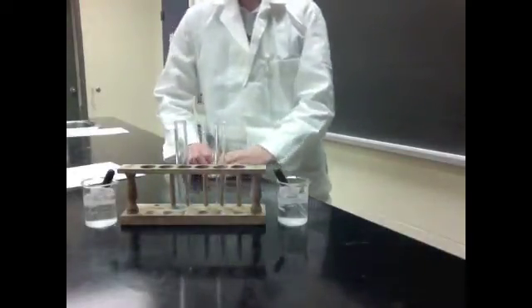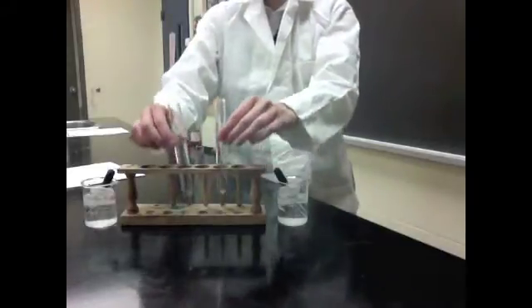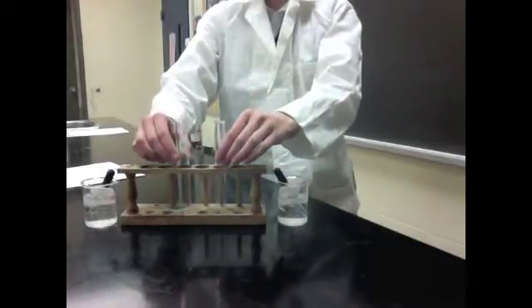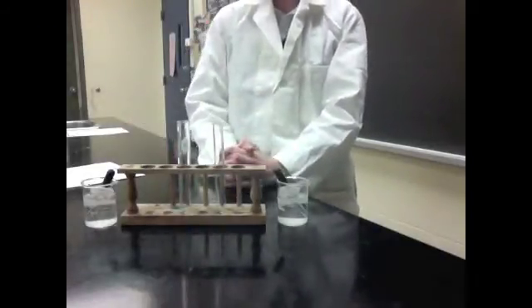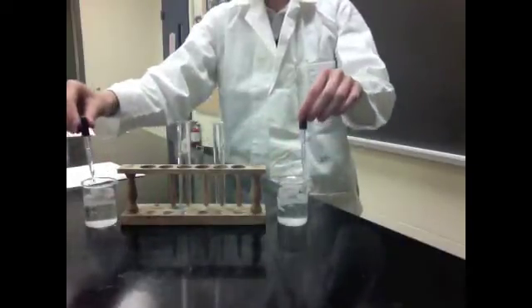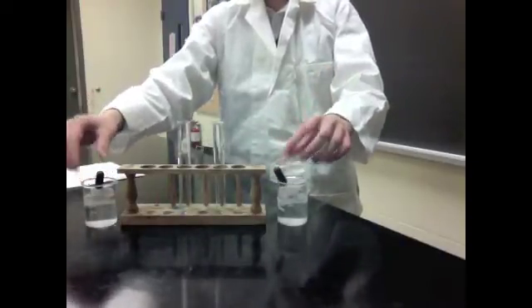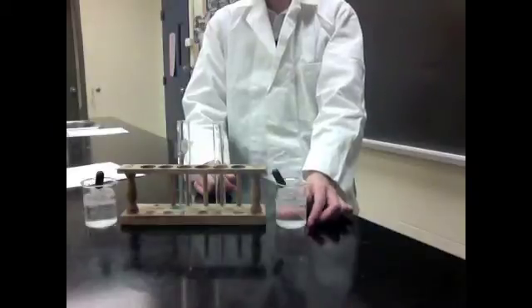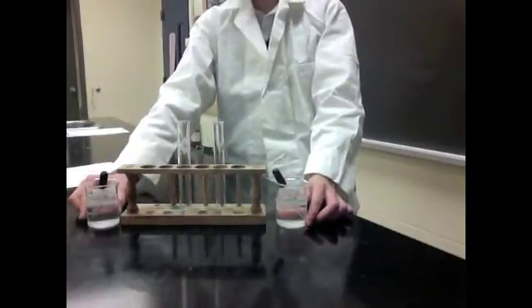For this experiment we're going to need two clean test tubes, or else they will contaminate your experiment. We're also going to need two eyedroppers, and your teacher will provide you with a beaker full of potassium carbonate and a beaker full of calcium chloride.